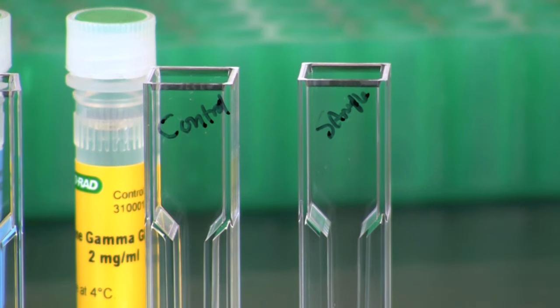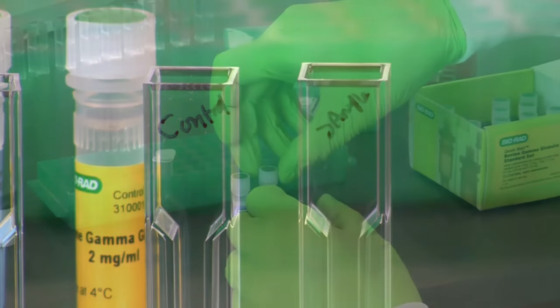Label 2 cuvettes, one control and the other sample. Do not handle the cuvette where the light passes through and make certain your labels are well above this area. Pipet 20 microliters of diluted milk sample into the cuvette labeled sample and 20 microliters of 1x PBS into the cuvette labeled control.